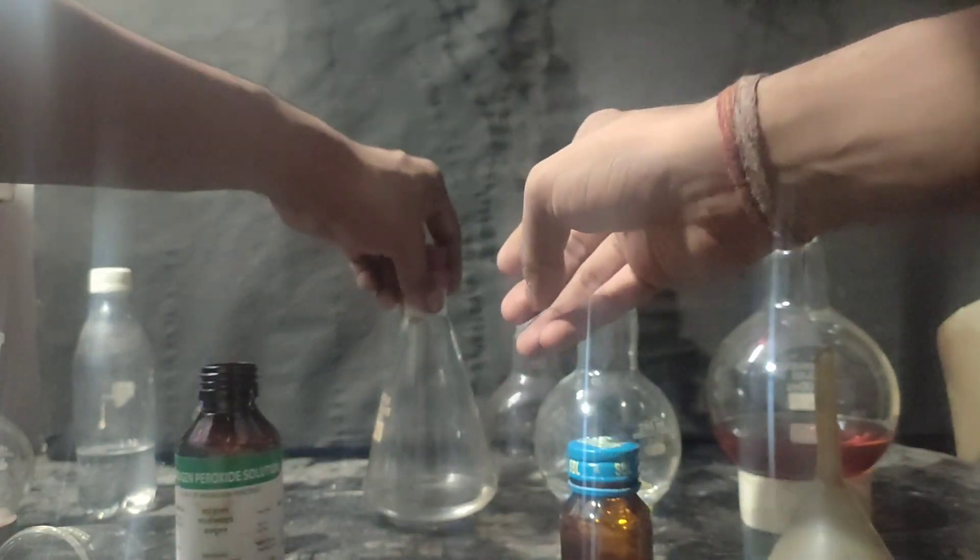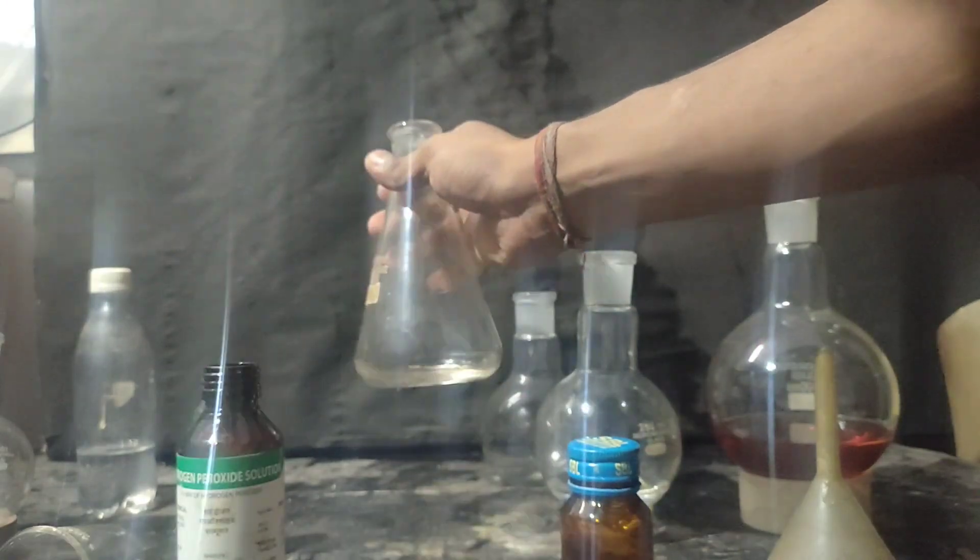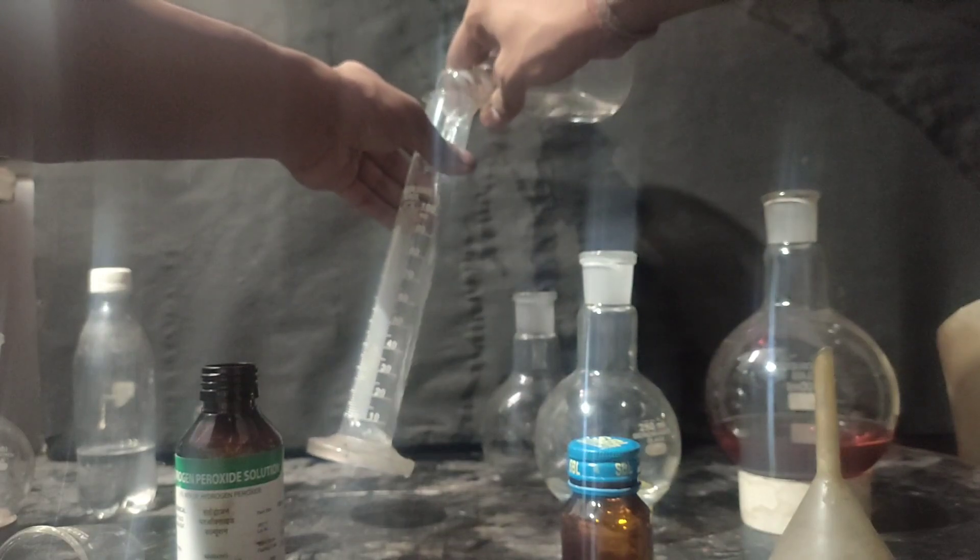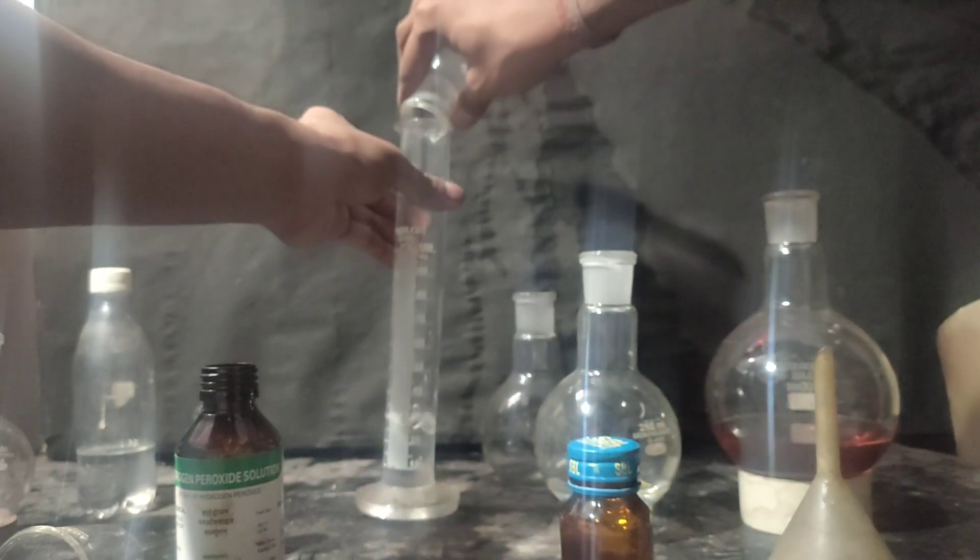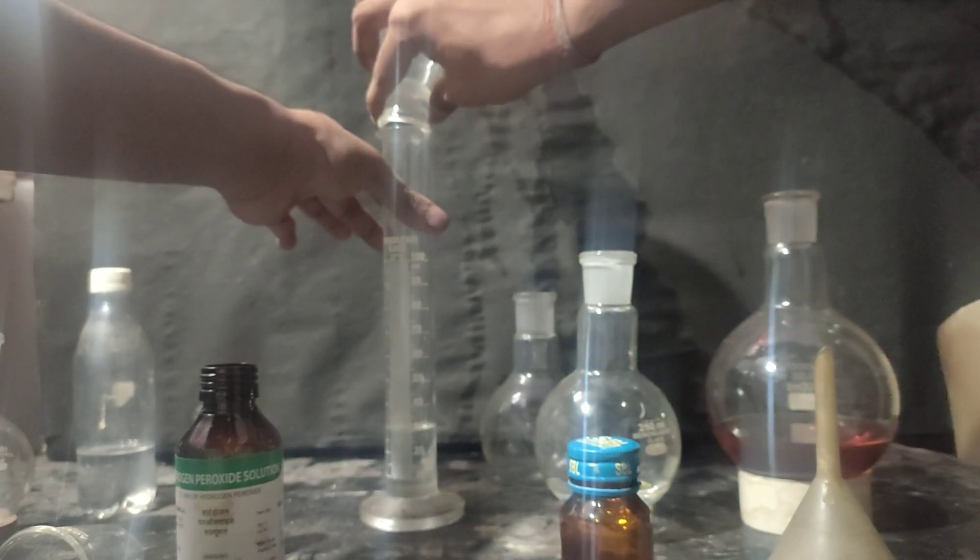This is the third fraction that came around 90 to 102 degree celsius. And its volume was around 30 ml.